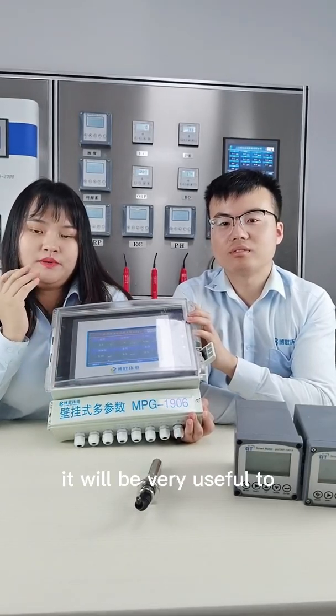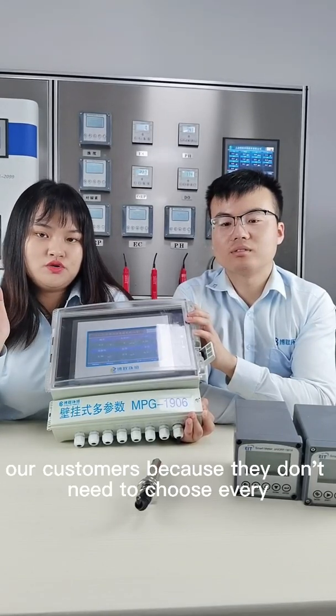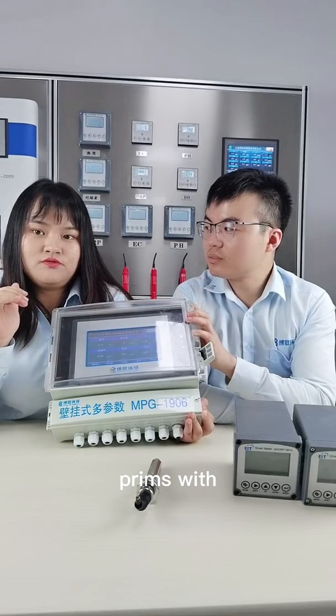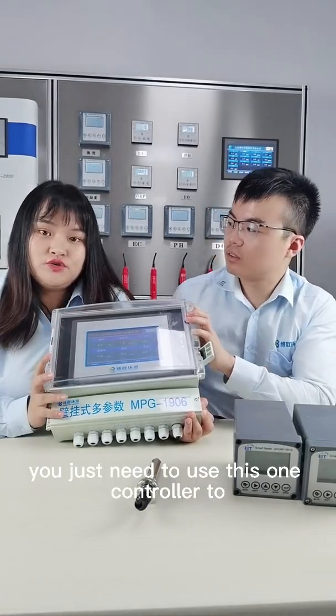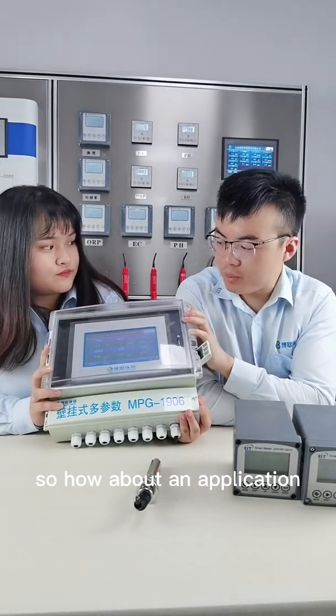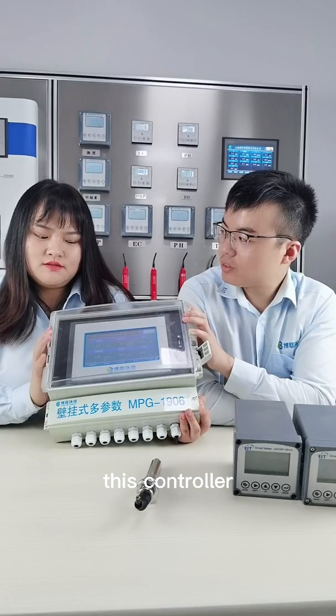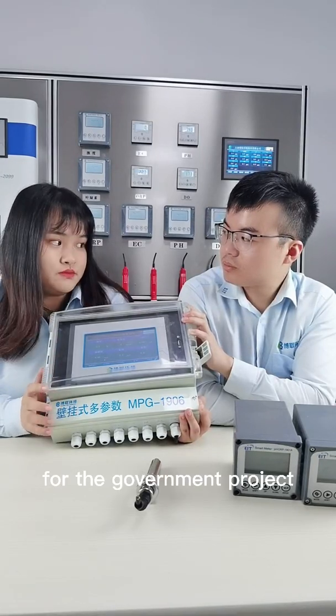It will be very useful to our customers because they don't need to choose every parameter with each meter and sensor. You just need to use this one controller to meet your requirements. Okay. So how about the application? This controller is mostly used in wastewater treatment for government projects.